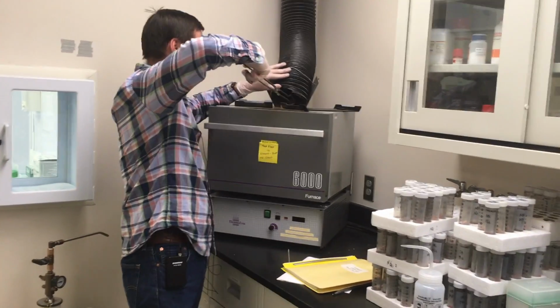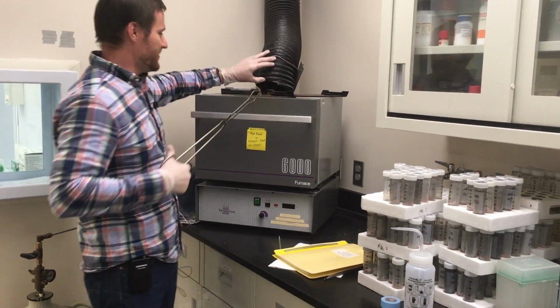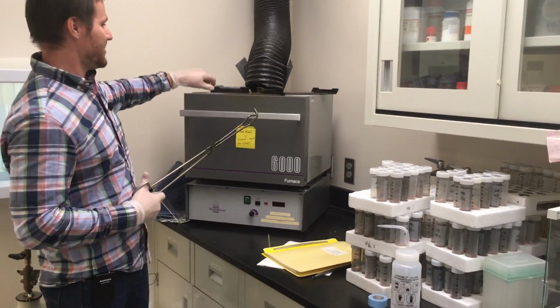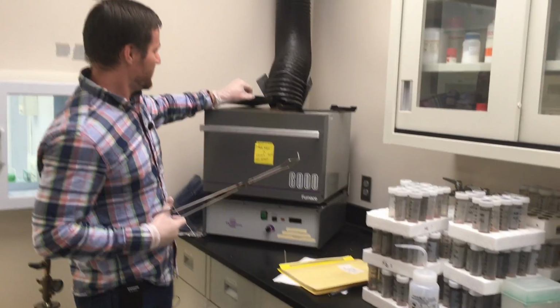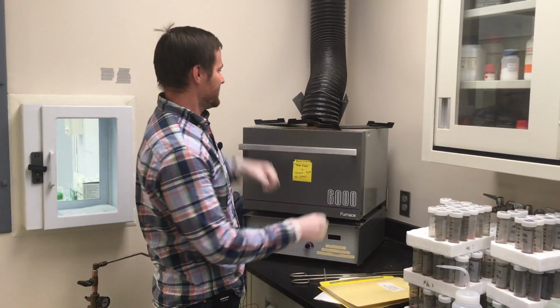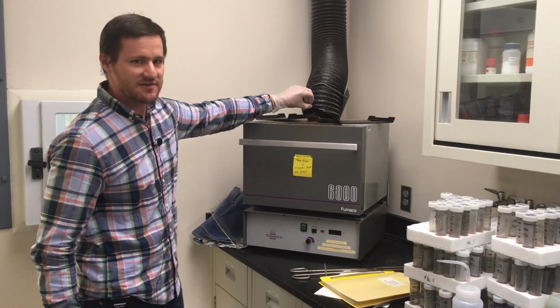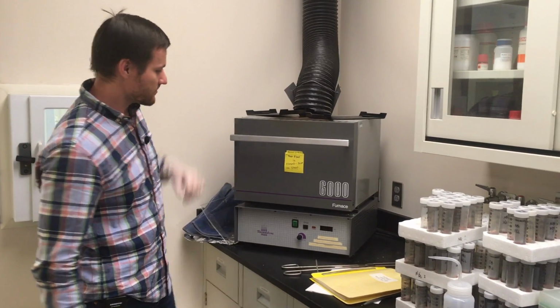And you just put the flap over the vent. Intuitively, if it's covering it, it'll stop it from venting. And I'll also throw these on, kind of just as paper weights for the vent. One will do the job here, but it keeps the flap closed so it won't vent.